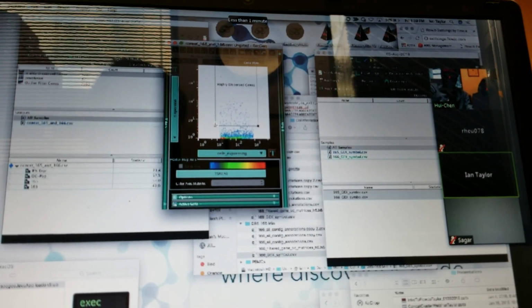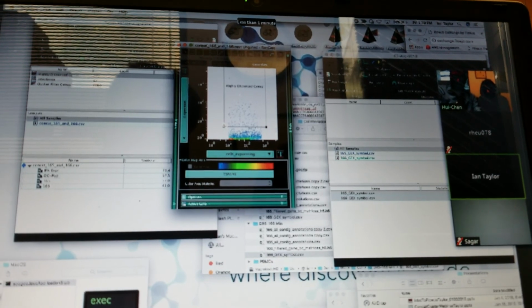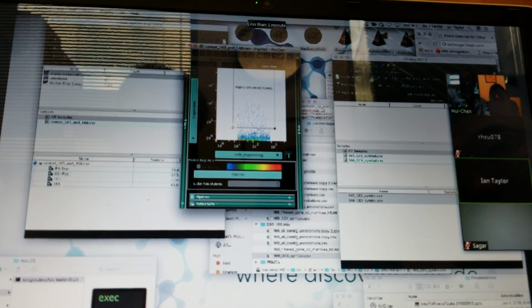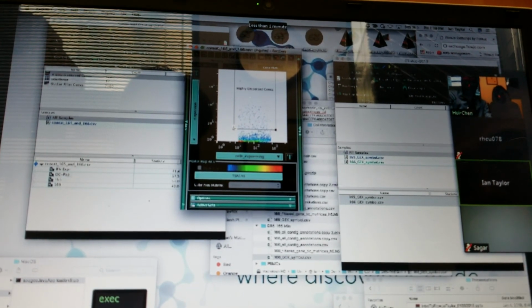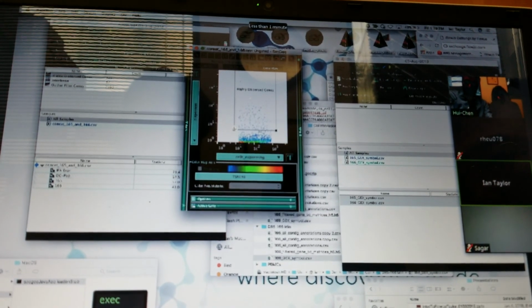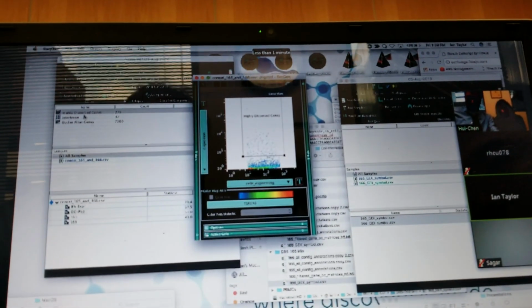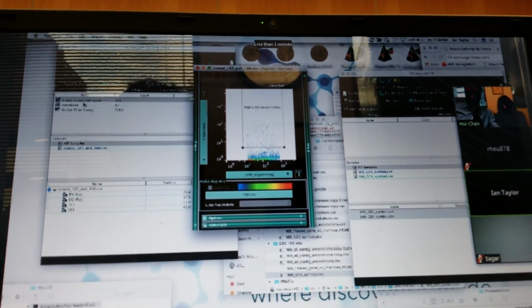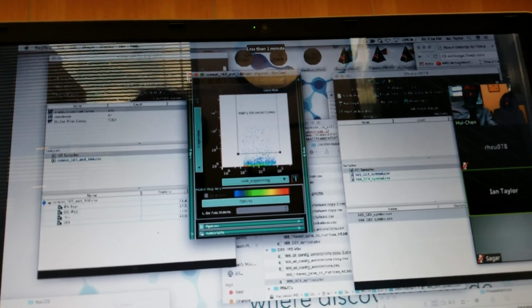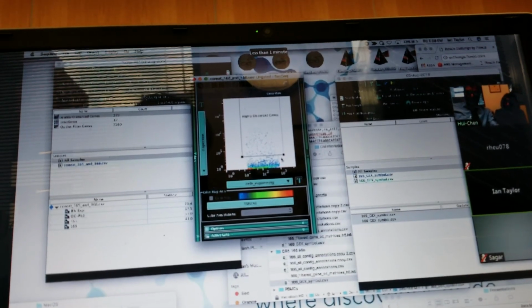And what is dispersion? What does dispersion mean here? Yeah, so it's related to variance, and we find in practice that the more variable a gene is, the more likely it is to describe a biologically significant population. And so, again, this is all just drilling down to a set of genes that I want to use for dimensionality reduction and then clustering. I mean, it seems as though you're eliminating a lot of, or you're capturing just a few cells that, these aren't cells, these are genes.